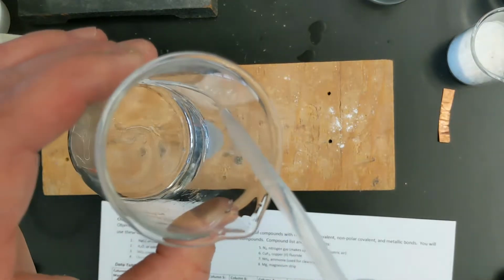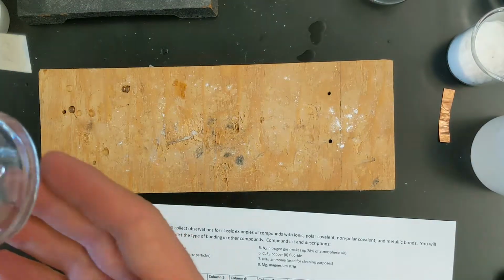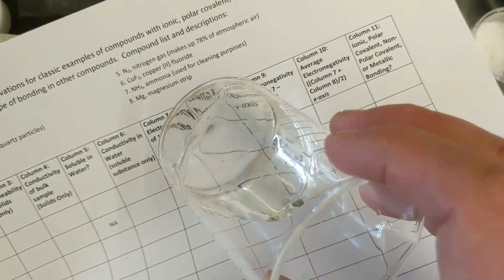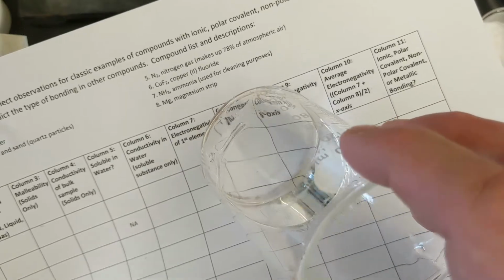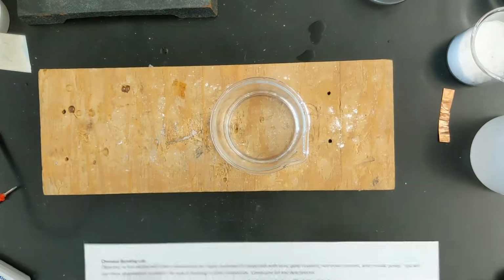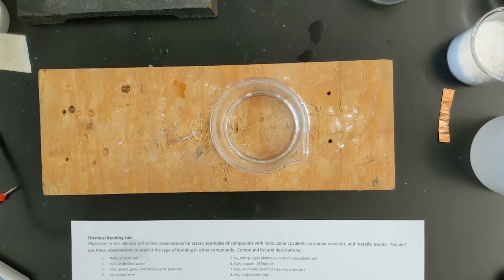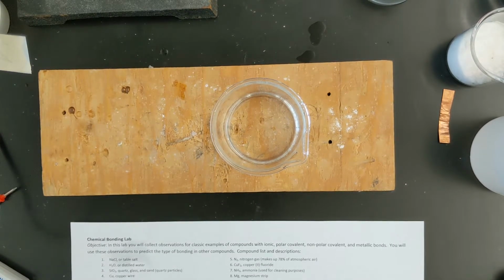And what I can see happening, and it might be hard for you to see, is there are two different layers forming on this. You definitely aren't going to be able to see it very well in this. If it was colored, we'd be able to see a little bit better. But it is separating into two different layers, a water layer, aqueous, and the oil layer. Because these are not miscible, meaning they won't form a homogeneous solution together, they separate. The mineral oil is not soluble in water.